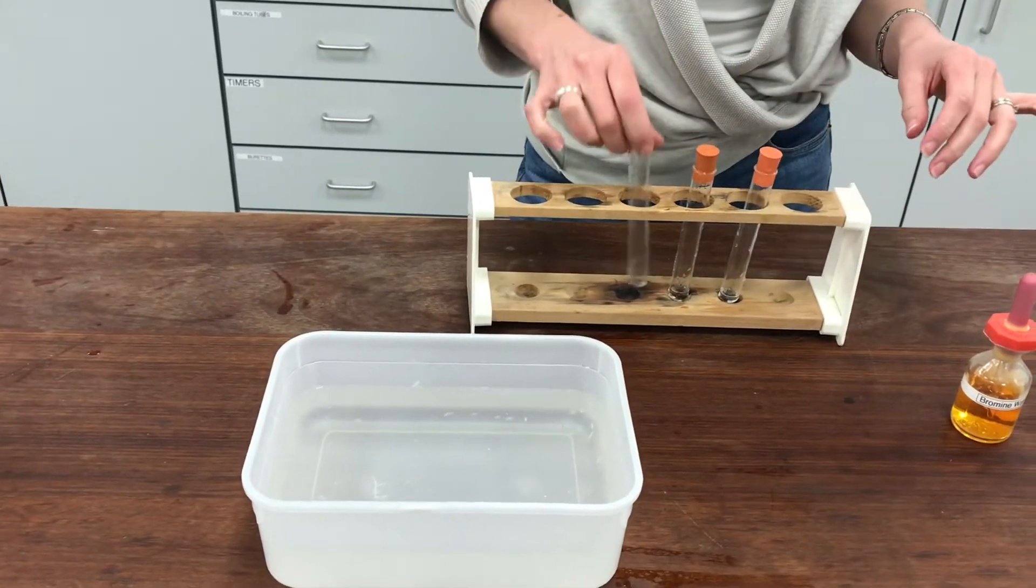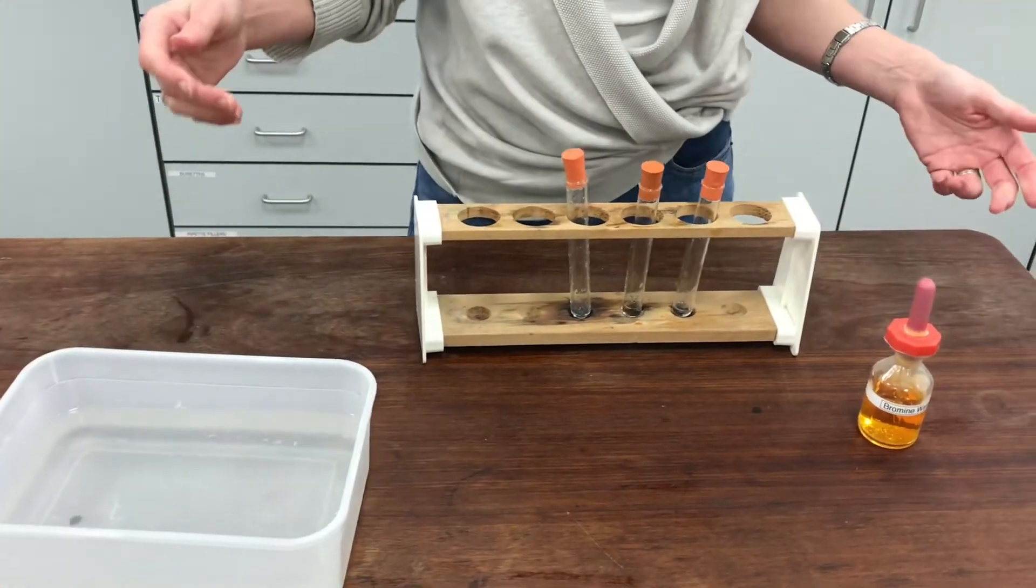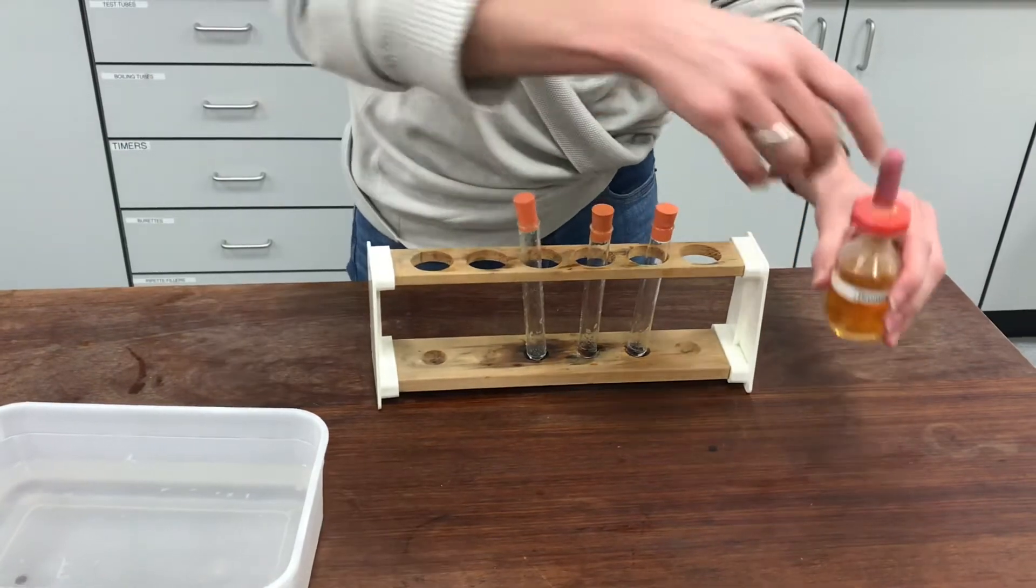I might only need to test the one. I'm going to test them using some bromine water and see if I can demonstrate that it's not an alkane in that tube.